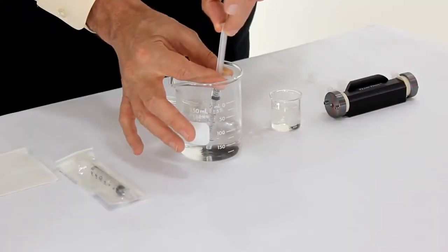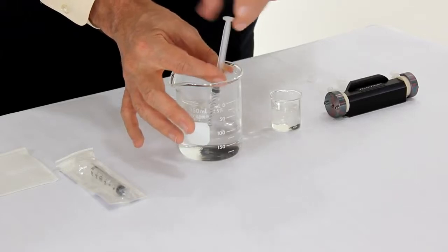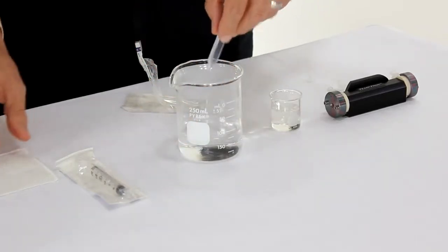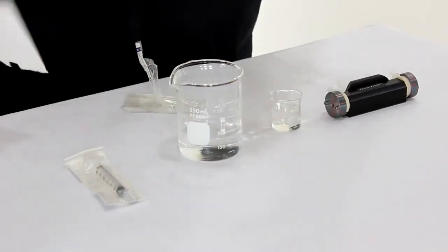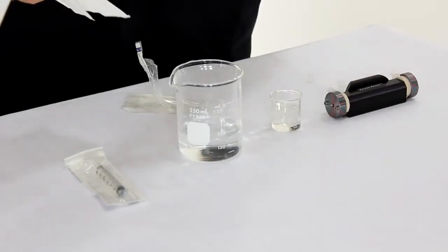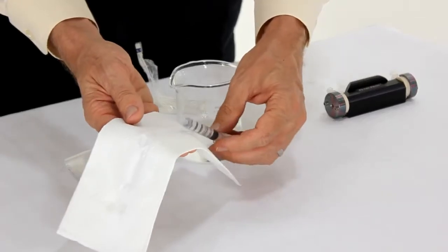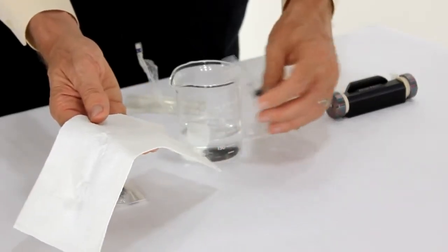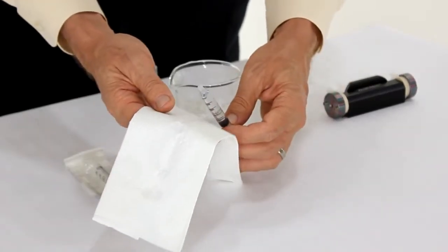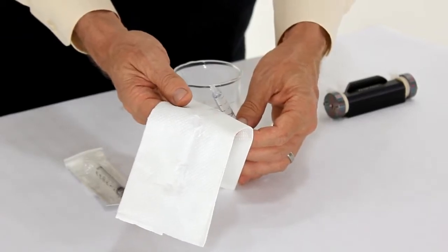Fill the syringe with the blank. It's important to note that in this case for the video I'm using sucrose and water which obviously is not harmful, but in a real life laboratory environment it would be preferable to wear gloves while doing this. Air bubbles are your enemy in this situation so I will remove the air bubbles before I put them into the cell.